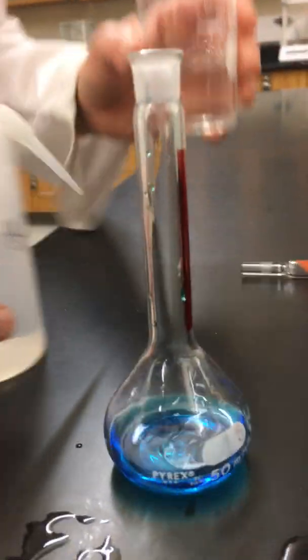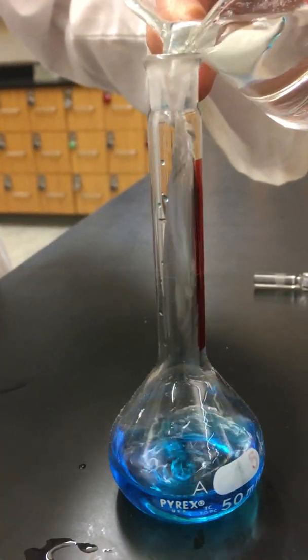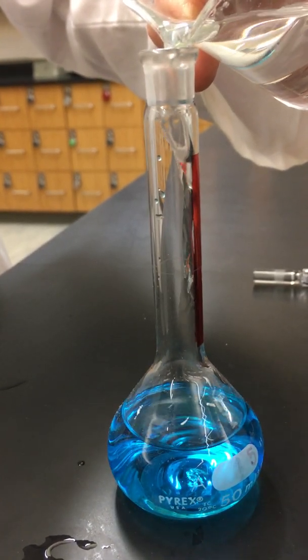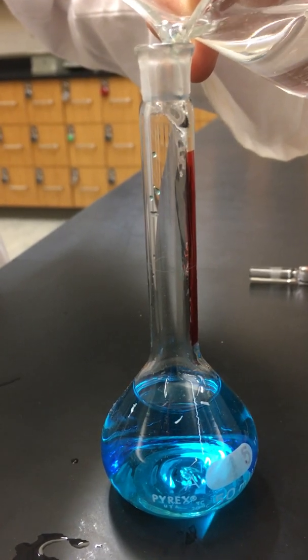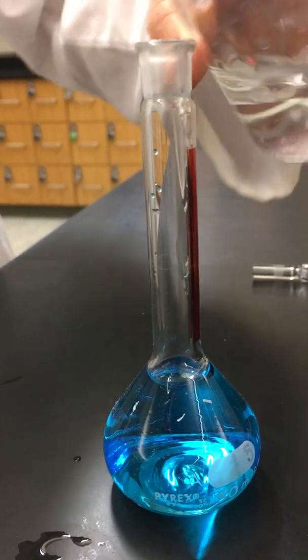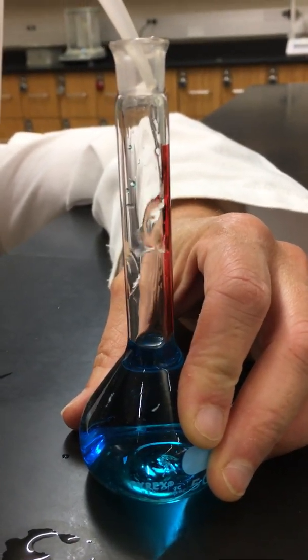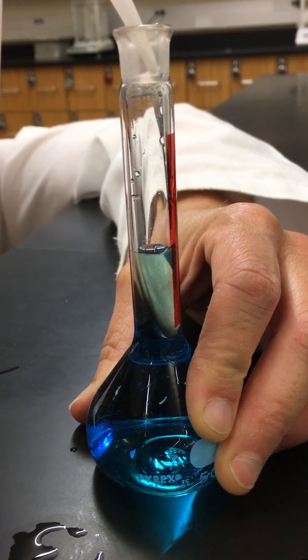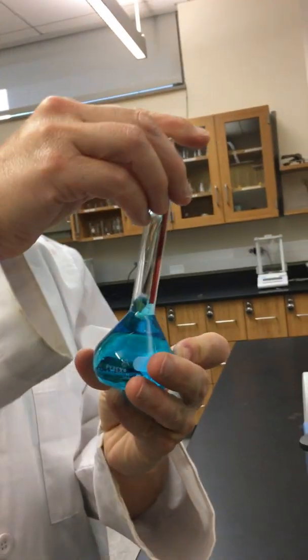Solution number four. And then our final solution.